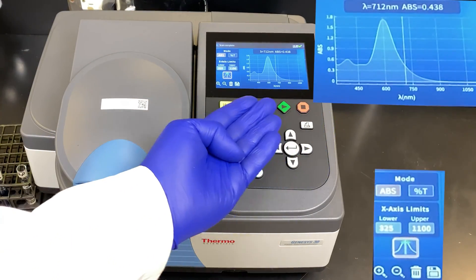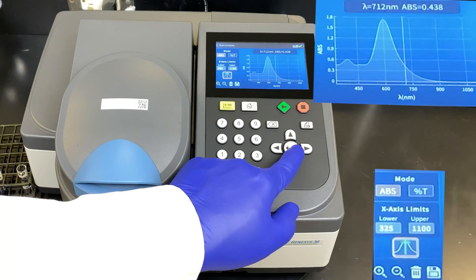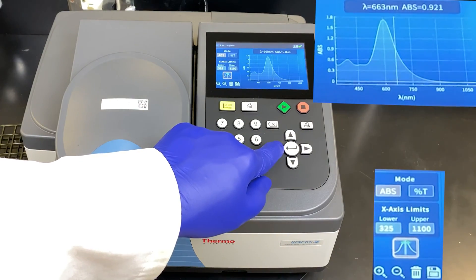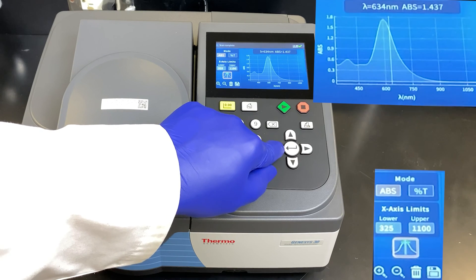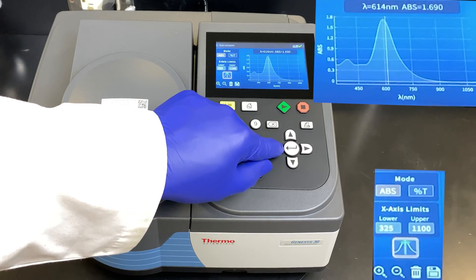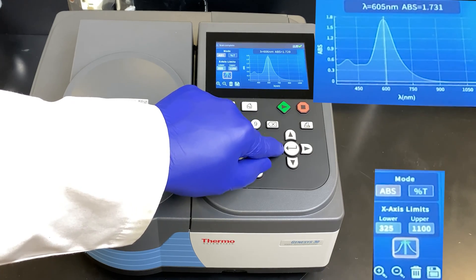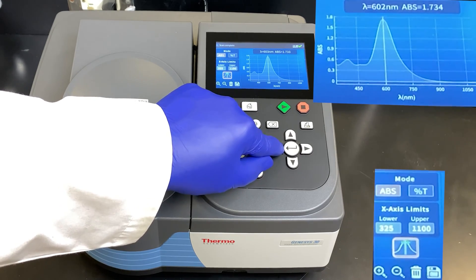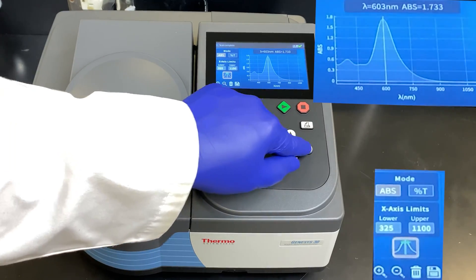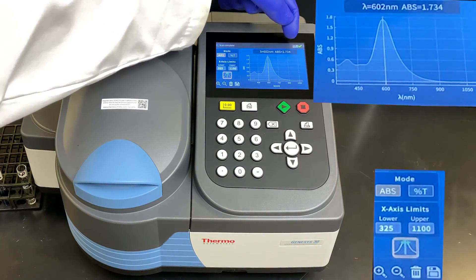Once the scan is done, the graph remains on the screen and you can actually interact with it. You can move the cursor over, moving the wavelength, and read off the absorbance. Let's try to determine what the maximum absorbance is. Moving over — 1.6, 1.7, 1.73, 1.74 — it appears that AMAX is 1.74 at 602 nanometers for Janus Green B dye.